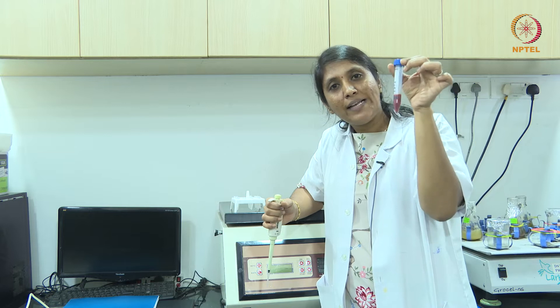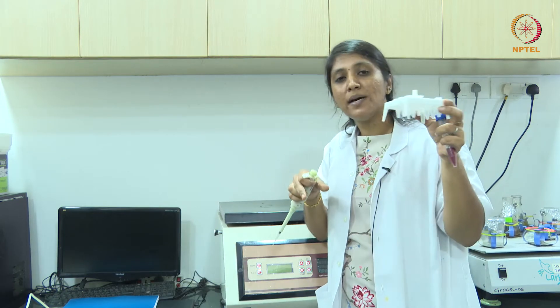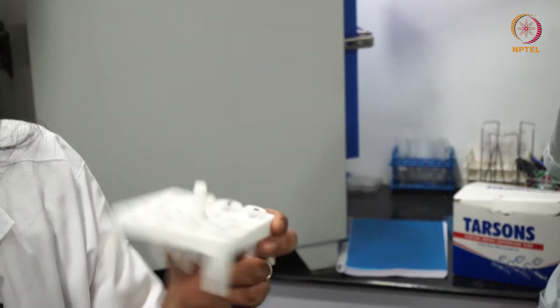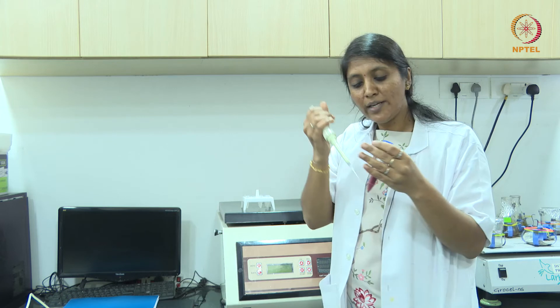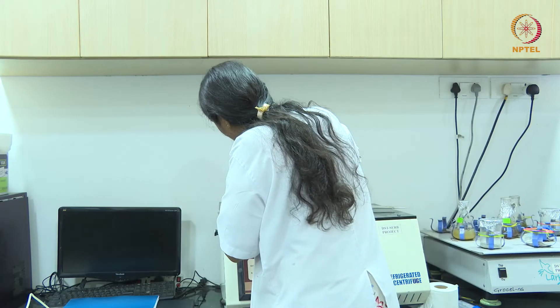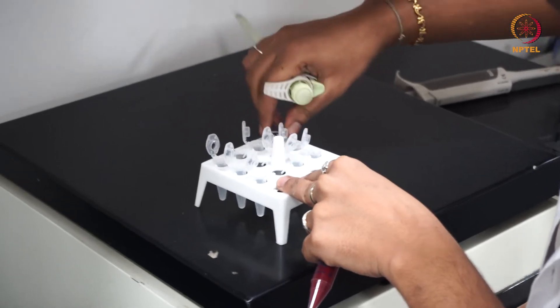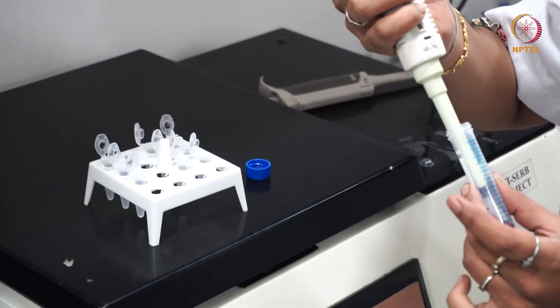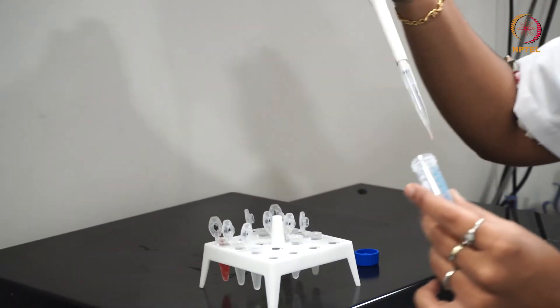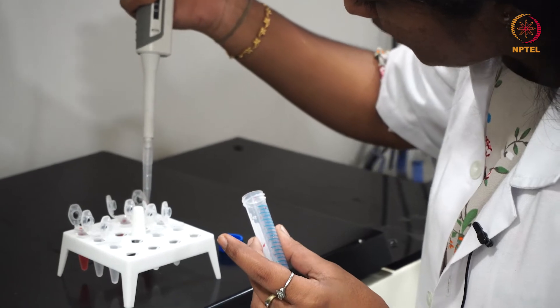In the first step, we collected the blood sample, then processed it. In the second step, we weighed bioactive nanoparticles and dispersed them using the sonicator. Now the particles are also ready. In the third step, I am going to add 50 µL of RBCs into these tubes — that means into the positive control, negative control, as well as the test materials. 50 µL of erythrocytes is exposed into positive control, negative control, as well as the test material triplicates.